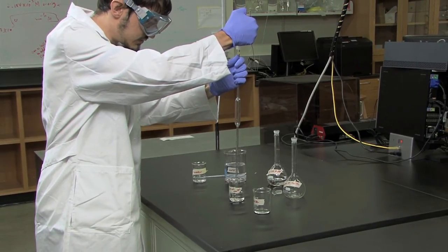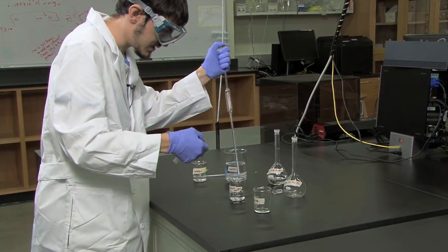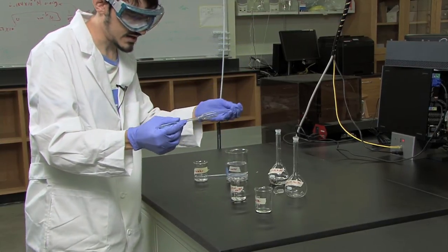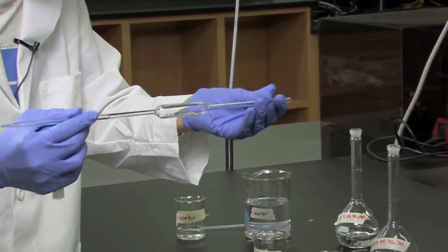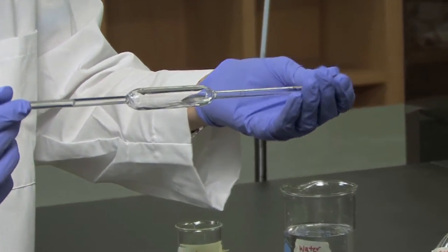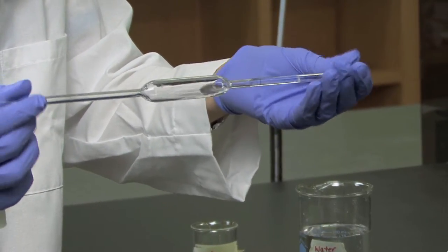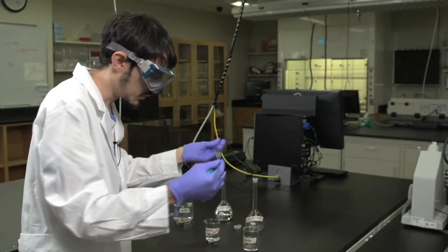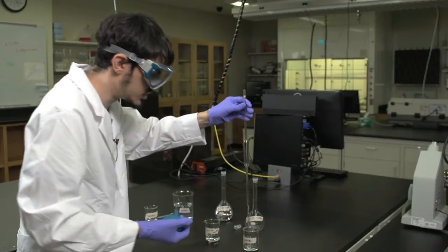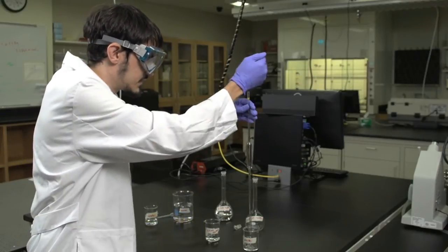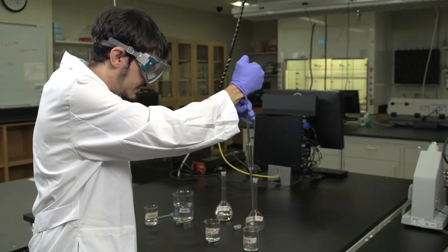Draw up some of the solution into the pipette as before, and roll again as before, covering the entire length of the volumetric pipette. Once this is finished, allow the solution to drop into the appropriate waste beaker, and carefully blow out the remainder of it.